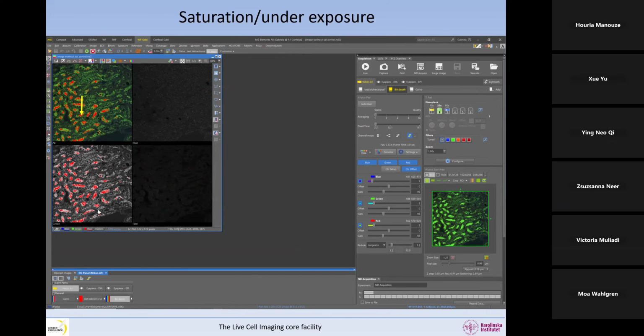Here we have saturation, so everything that is red. If I put my mouse above one of the pixels that are color-coded in red, I can see here on this Nikon software, but you will see it anywhere else in your software. If you hover your mouse over the image, you will see somewhere these numbers, and these are the coordinates of the mouse inside the image. And then we have the intensity of the 3 channels, channel 1, 2, and 3.